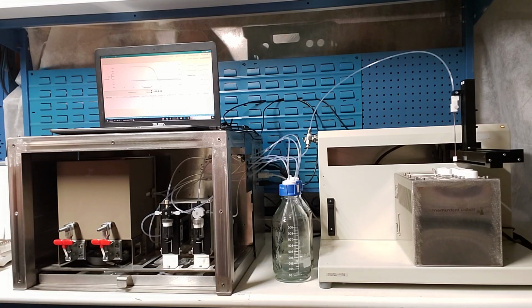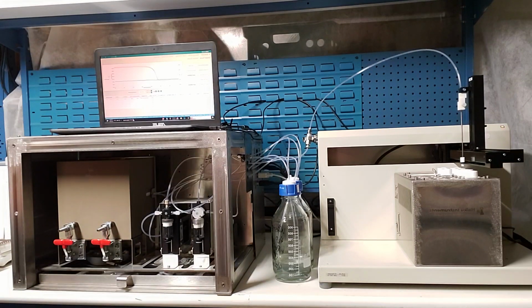In classic mode, what we're doing is emulating older automated capillary systems that were operating on what we call synchronous or serial connections. Only one action can be taken at any given time. Modern instrumentation uses asynchronous programming, allowing us to control multiple components all the time. This is what you've come to expect over the course of your career. And this is what we've done, is take those older methods and update them.